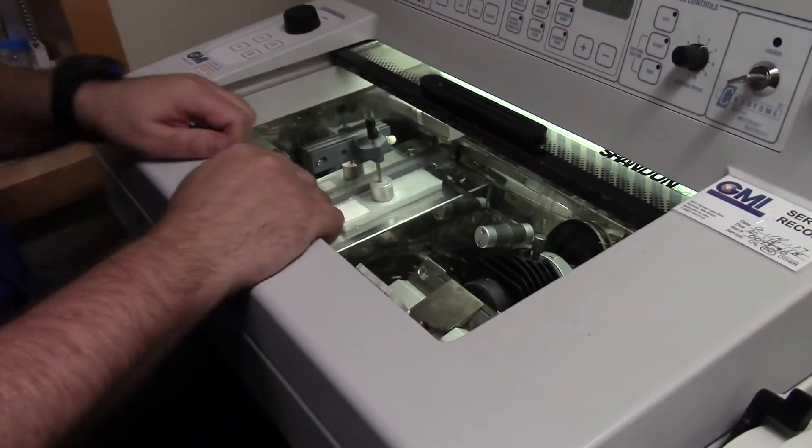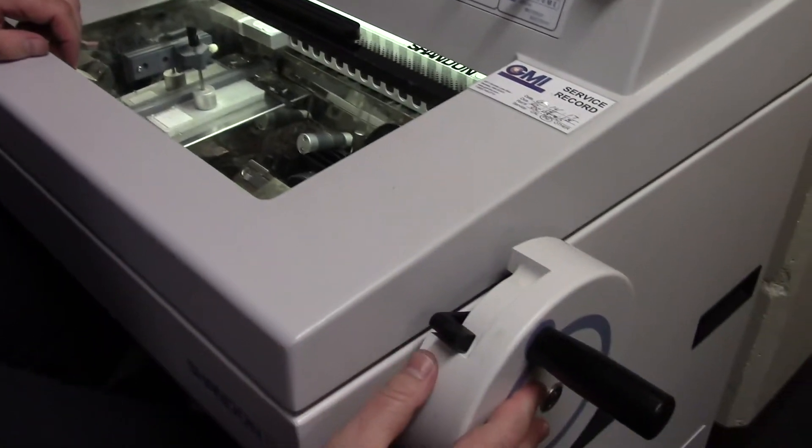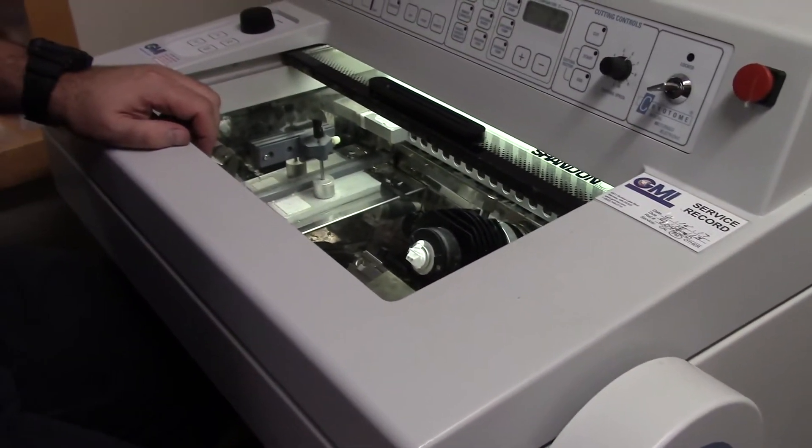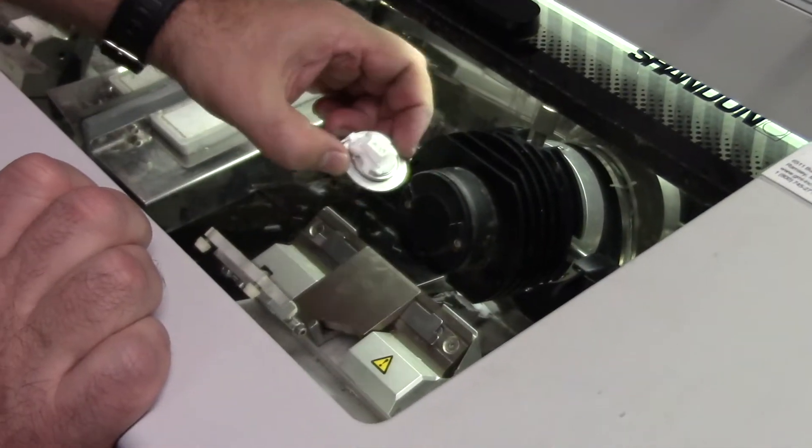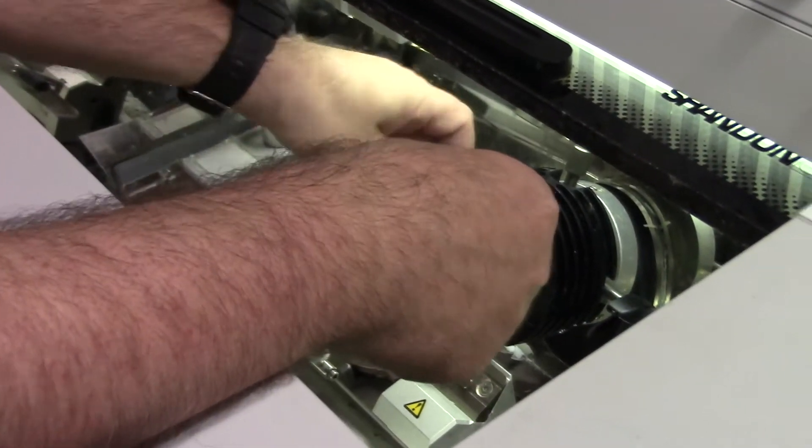Now it is fine for me to touch any part of this. So now I'll go ahead and unlock this again and bring it up higher so that I can easily get my tissue block off.